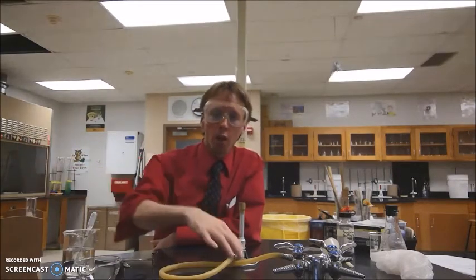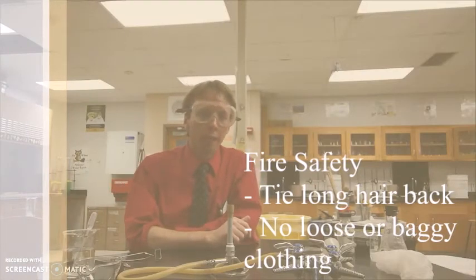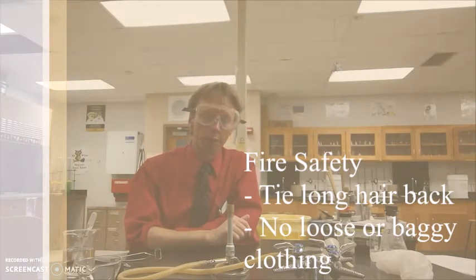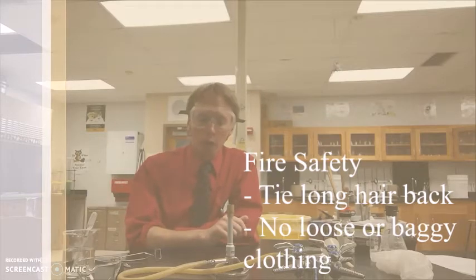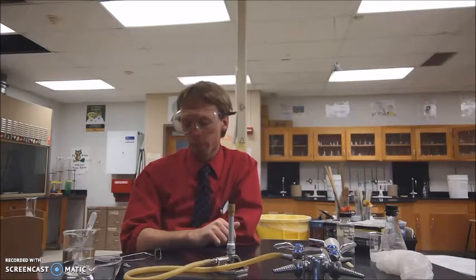To do that, we're going to use our Bunsen burner, and at this point, you're going to tie any long hair back if you have it, and if you have any loose articles of clothing, you're going to secure those, or if it's like a hoodie or something like that, you can take it off. You're going to check and make sure that the gas line underneath your station, that yellow lever, is pointed to the side and not straight down. And also check with your instructor to make sure that the main gas line is turned on as well.